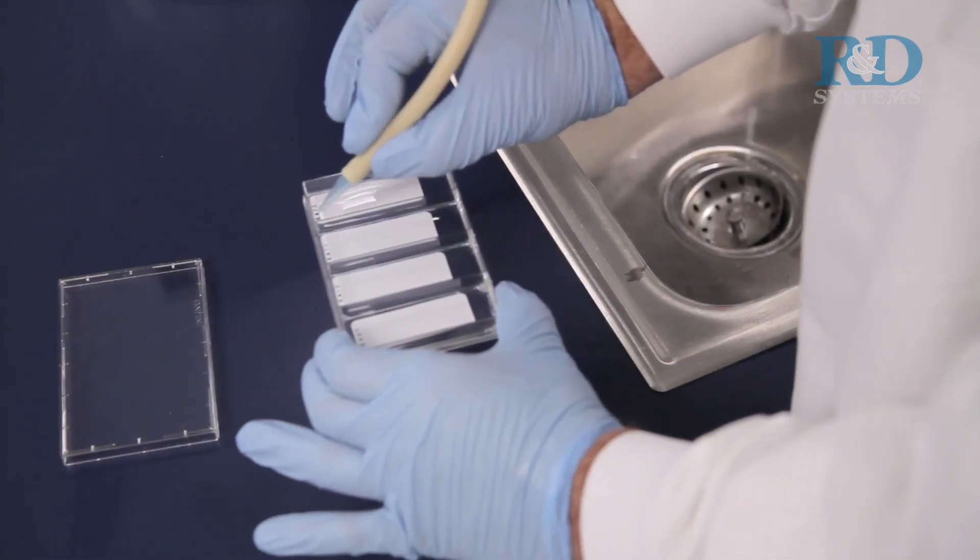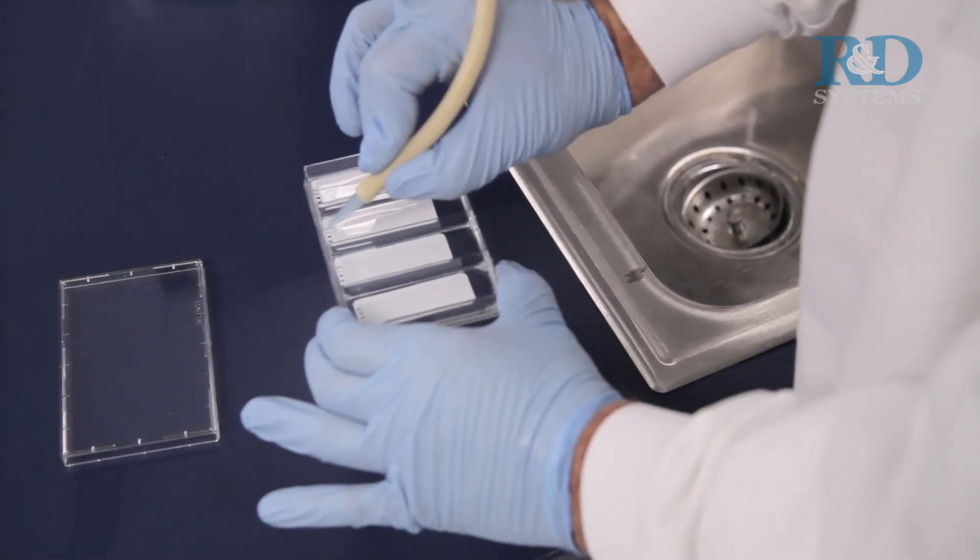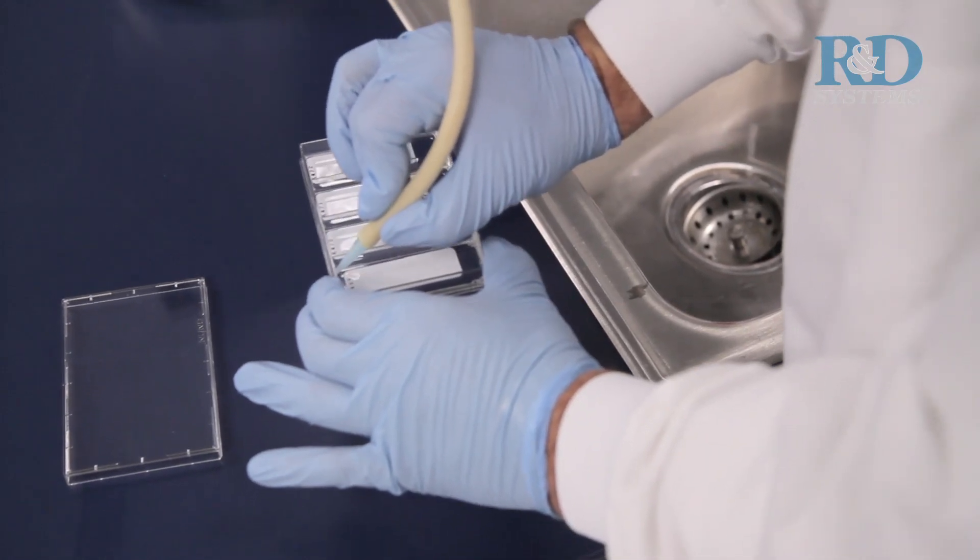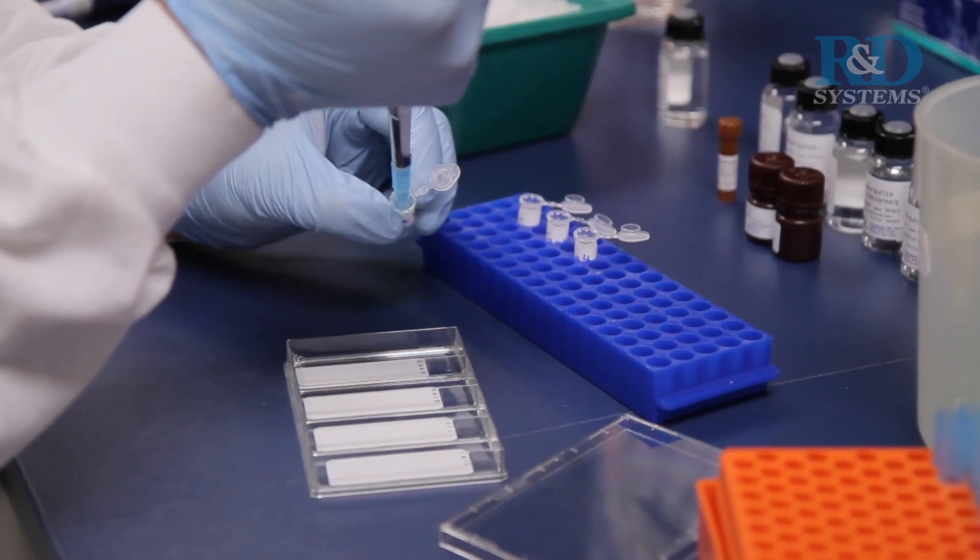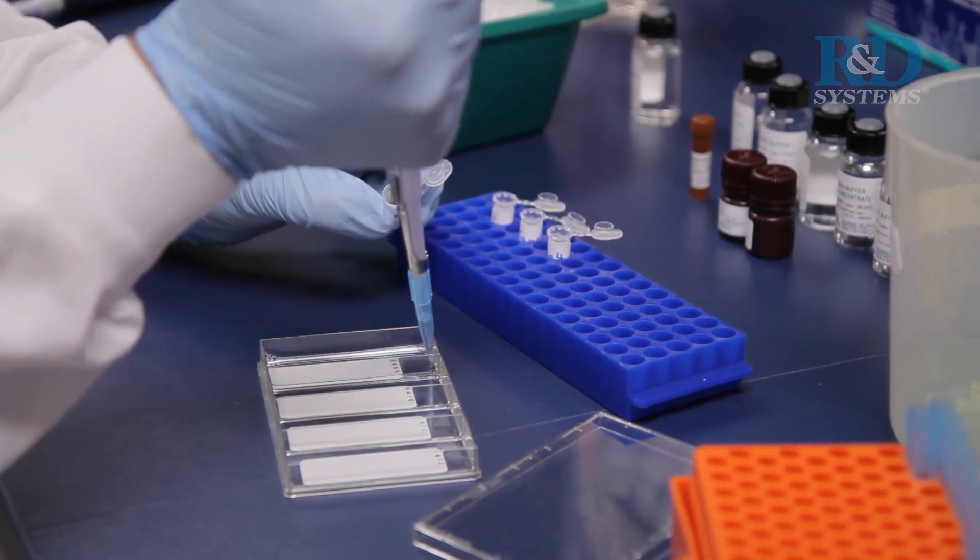Following incubation, aspirate array buffer 1 from the wells of the 4-well multi-dish and add the diluted lysate solutions. Place the lid on the 4-well multi-dish.